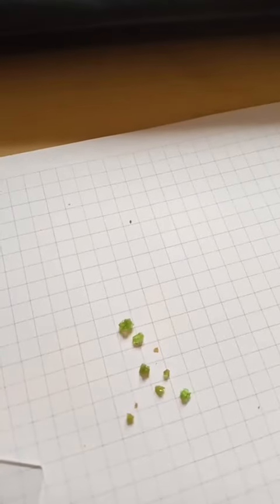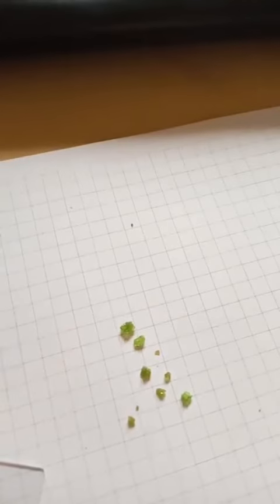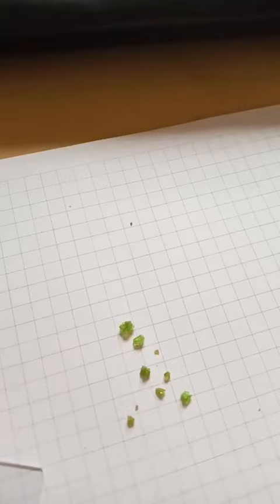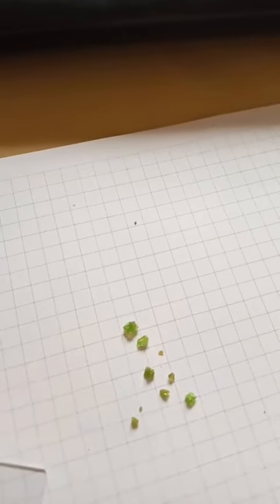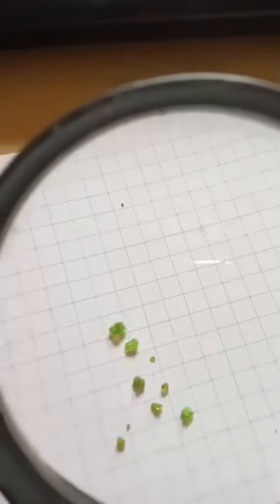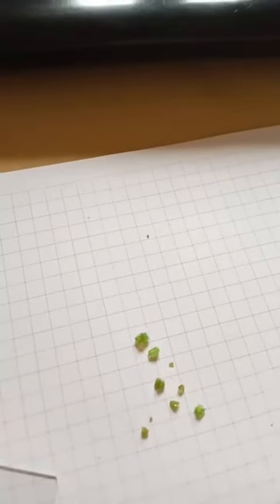Also, before it, we used simple microscopy or eyes to show the dimensions of this crystal. This crystal, I am very lucky, it is very large. I can see it by eyes. Also, I can magnify it by using a simple lens to show its edges or dimensions. Also, if these crystals are very small, we use microscopy and slides.